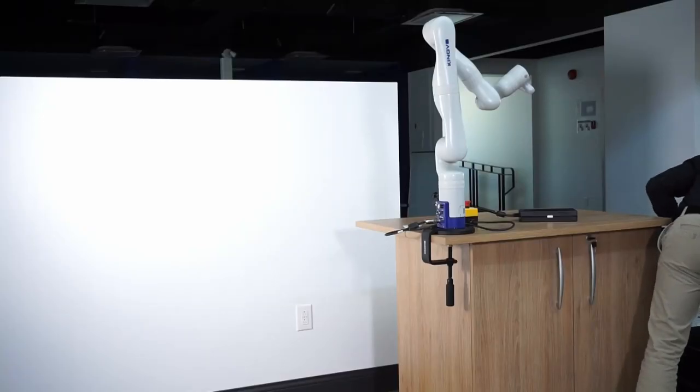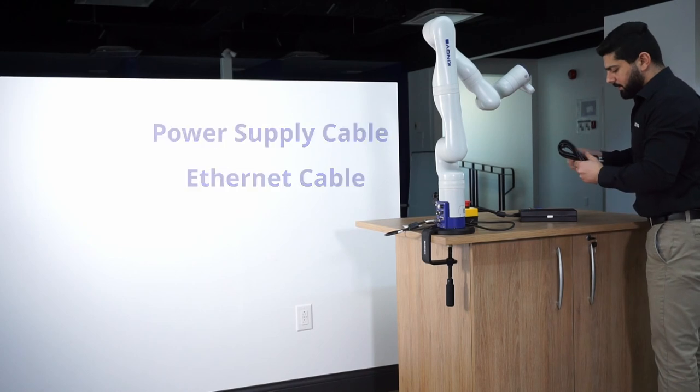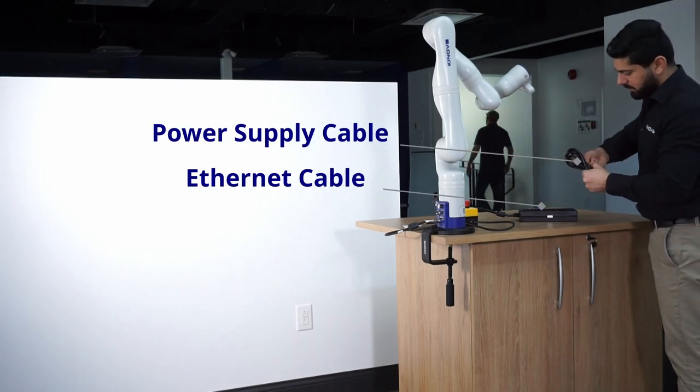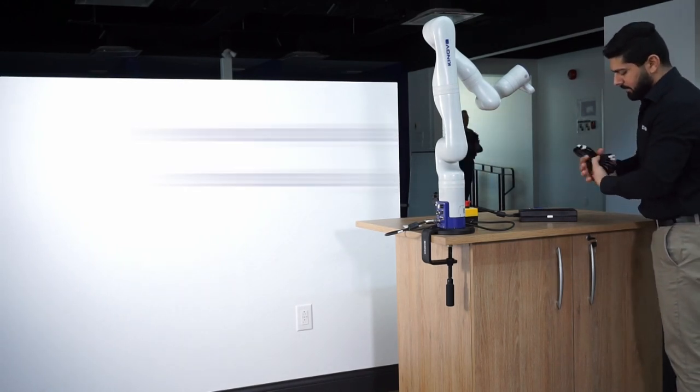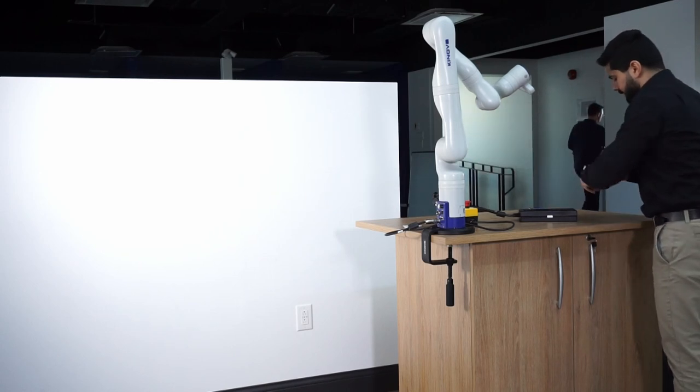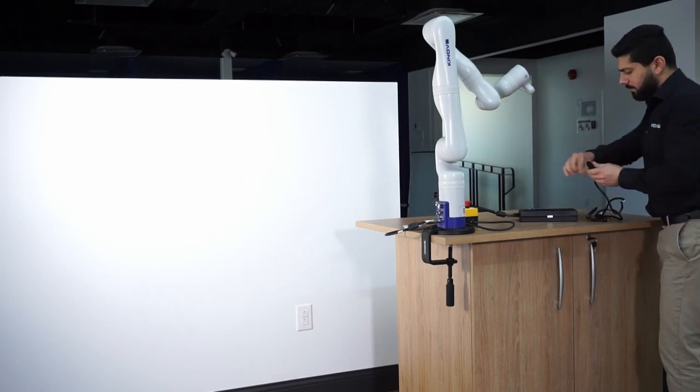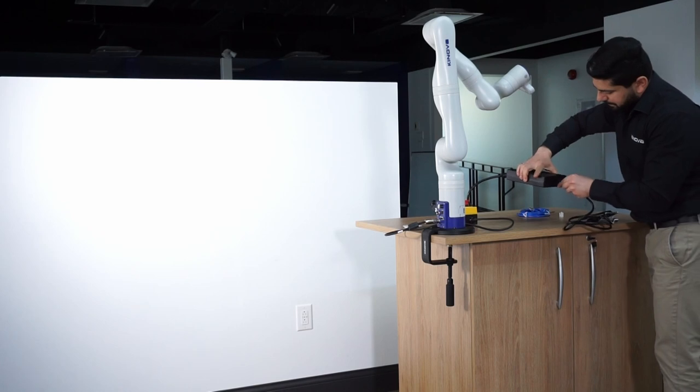In the third stage of the box, you will find the Ethernet cable and the power supply cable. Connect the power supply cable to the power supply, and plug it into the wall outlet.